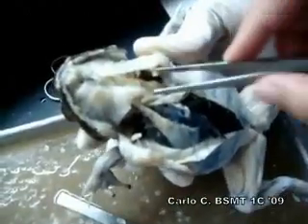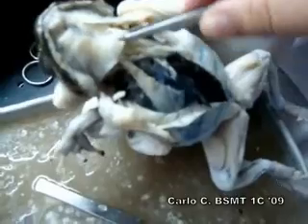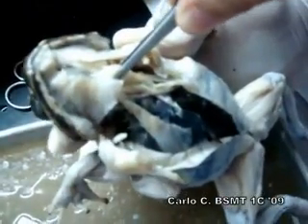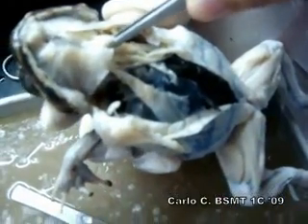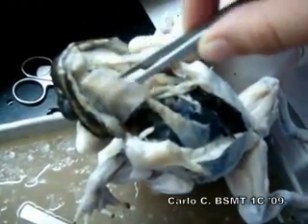The hyoglossus is this part. And then genioglossus is under the geniohyoid of this part.